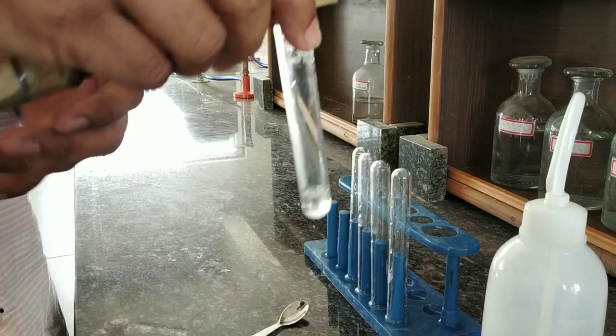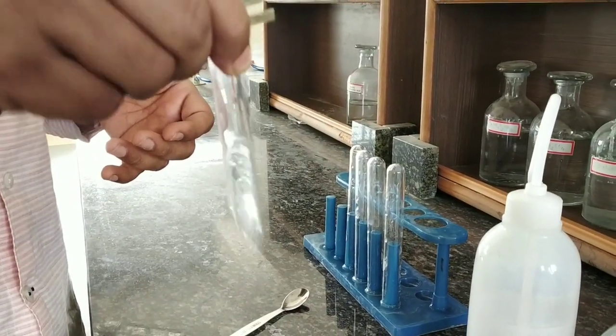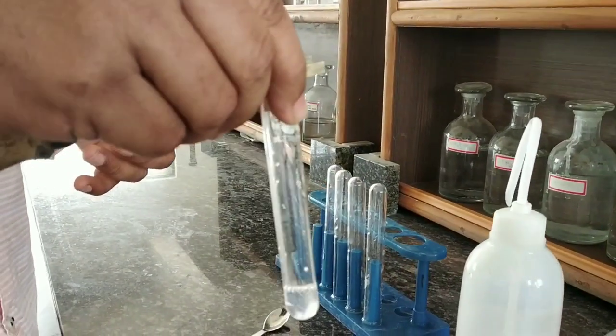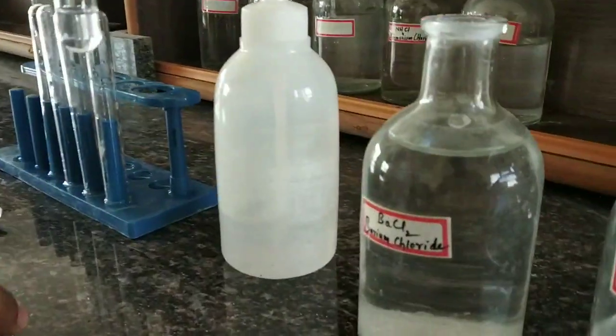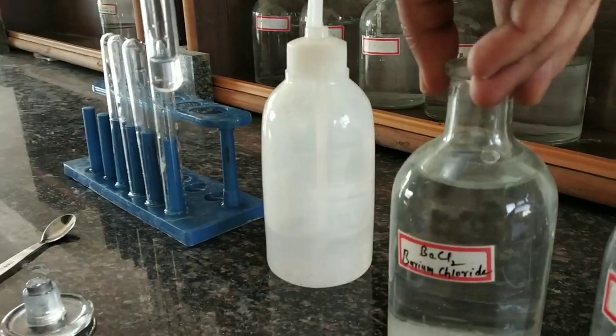And dissolve it. After dissolution, add barium chloride, BaCl2.